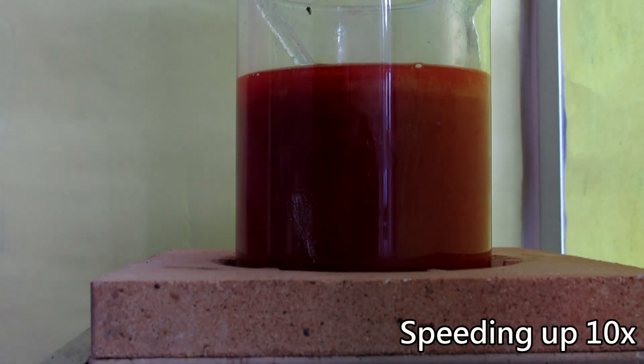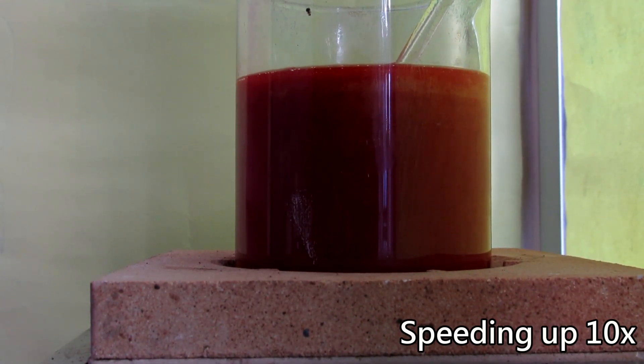After about 5 minutes, the solution has turned completely red. I decided to continue heating the solution for another 10 minutes to really make sure that all copper ions had been reduced to copper oxide. But I stopped when the solution started boiling, as the sugars in the solution started decomposing due to the high temperature.